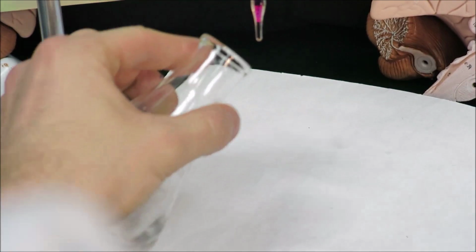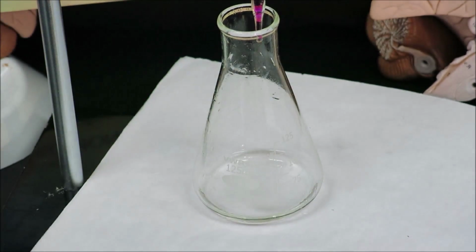Now we realize that the volume added is about, well, so far exactly 14.0 milliliters. We have a certain volume left in the burette. We need to make sure that this volume is enough to perform one final trial. Otherwise, we need to refill the burette.